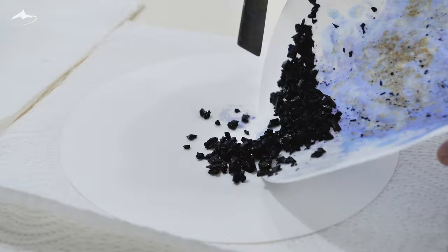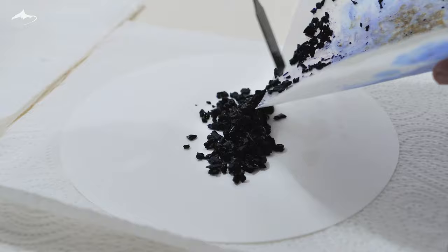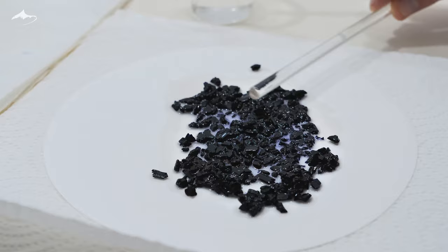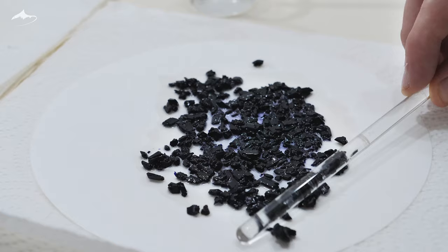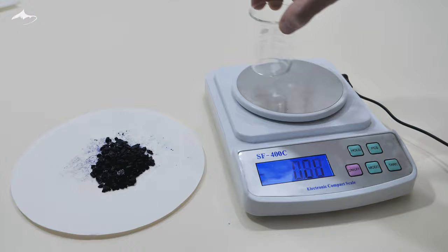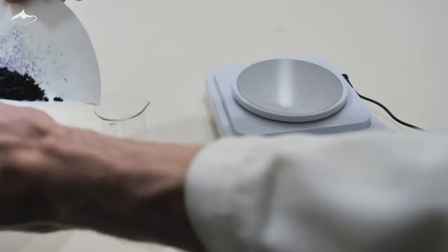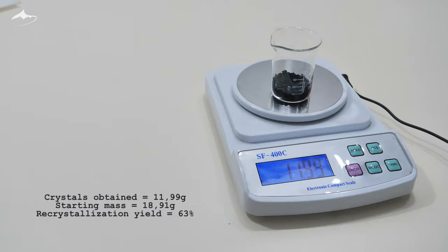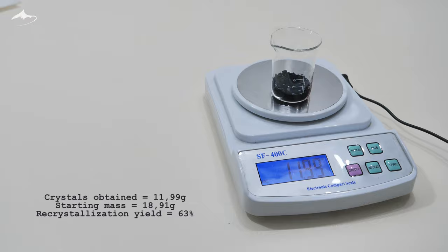Eventually all the paper had to be changed to rinse the crystals further as it was too wet to absorb more ethanol. After letting it evaporate for some time, I was able to weigh it to calculate some yields. And here is the final weight, almost 12 grams of beautiful big crystals of tetramine copper sulfate monohydrate.